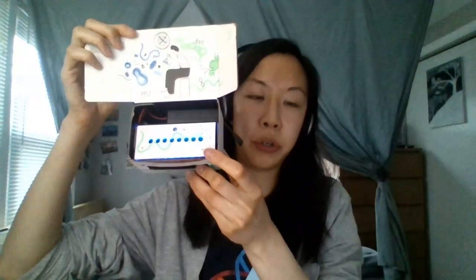So I will be using this box here. You can put your tubes in right up here at top. It's made out of cardboard, and it has blue LEDs that can shine up at your tubes, and then there's an orange filter in front that you can use to filter out blue light so you can actually see what's going on in your tubes. So we call this little box P51.